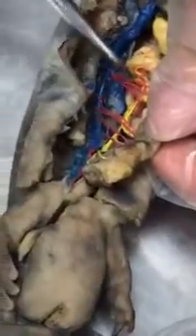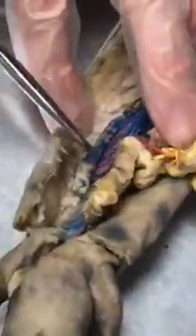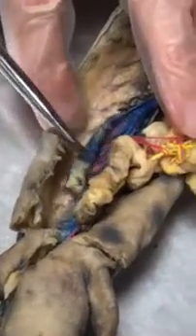And then for the celiaco-mesenteric artery, cross off just the celiaco because it got detached, but I want you to know the mesenteric arteries. So that's here. If you grab on the intestines and pull, you can see all the arteries. So mesenteric arteries. And then this big thing is a testis. So if you pull that over, you can see a whole bunch of vessels. Those are the genital arteries and veins.